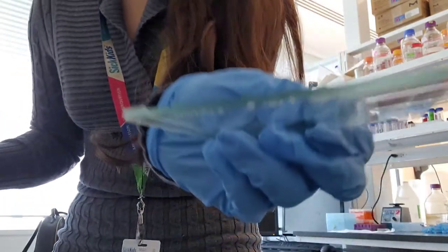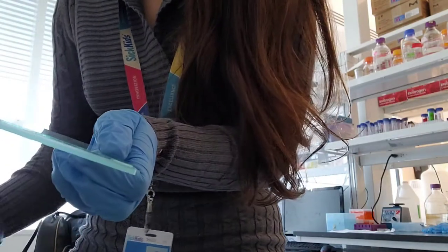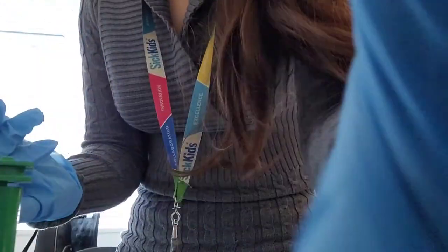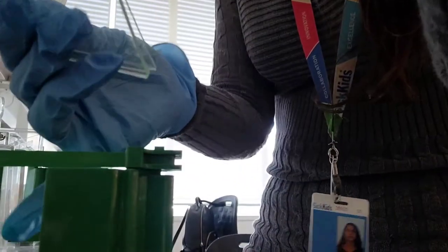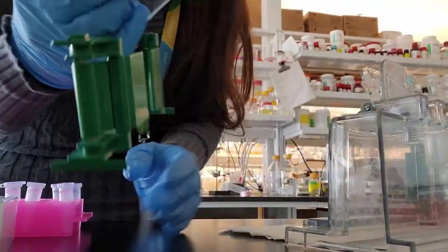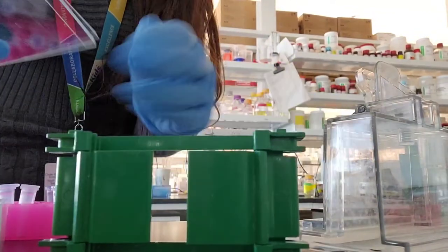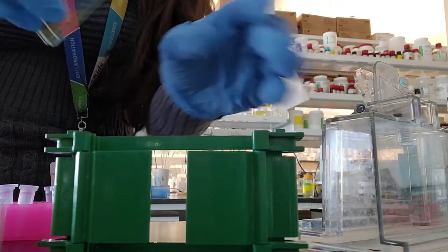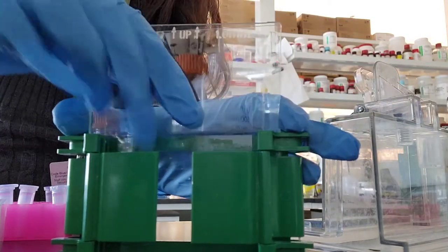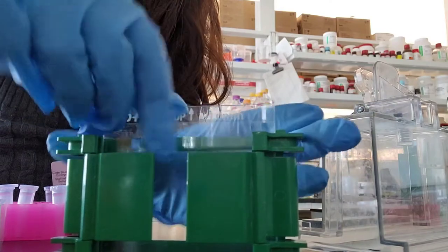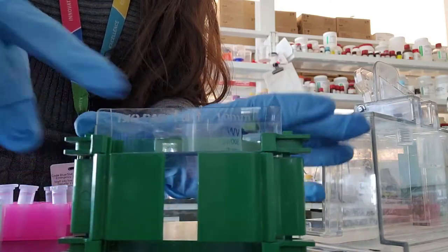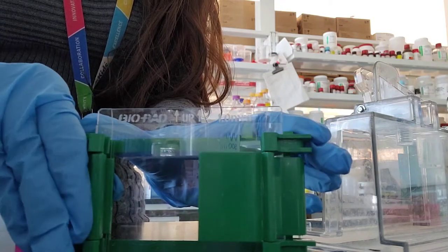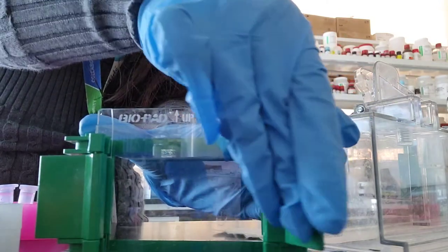Take one of those plastic glass holders that if you work or live in a laboratory you should have. You want to place your glass exactly like you're holding it into the plastic glass holder, pushing it in. Make sure they're exactly leveled and tap a little bit.